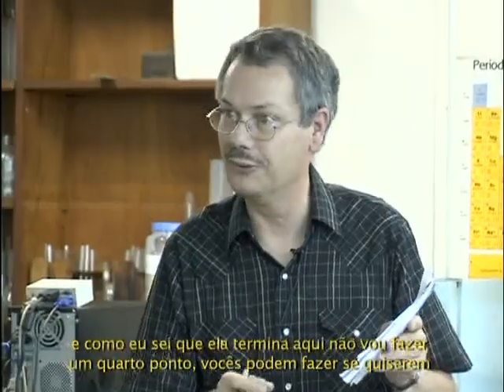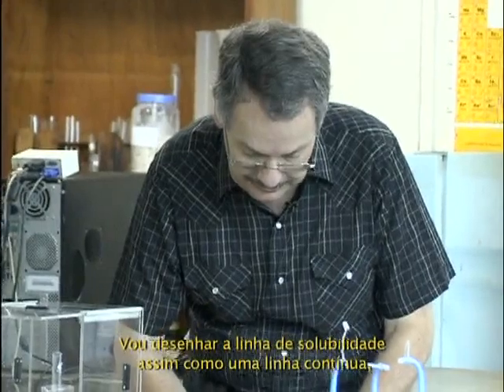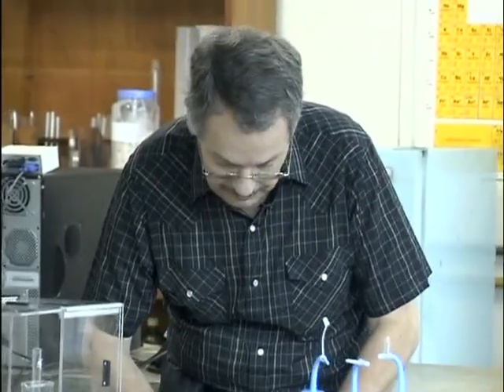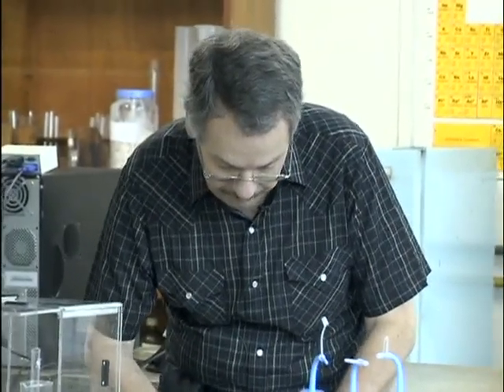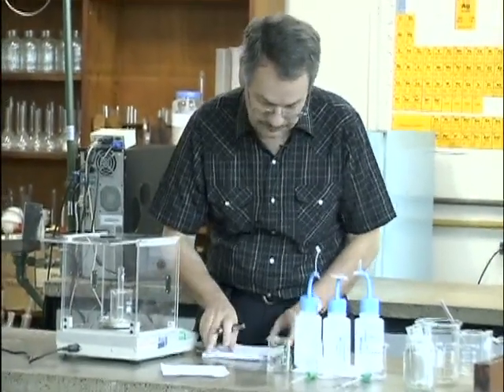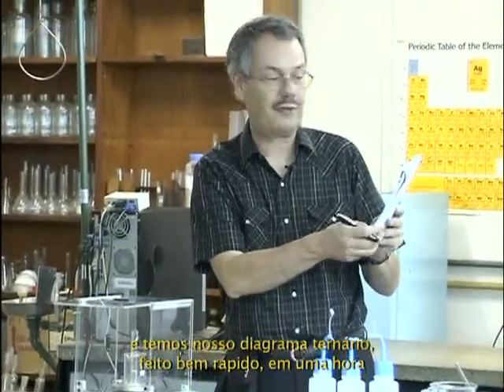You're welcome to do it if you want. I will draw the binodal curve this way with a continuous line. And we got our ternary phase diagram.